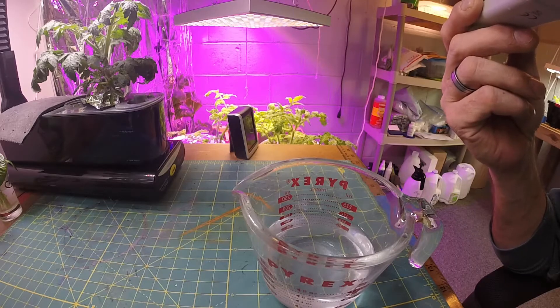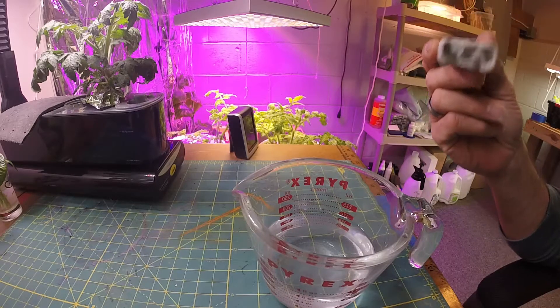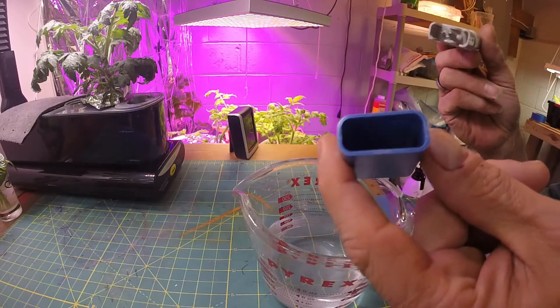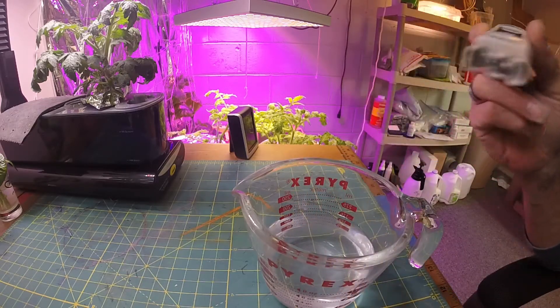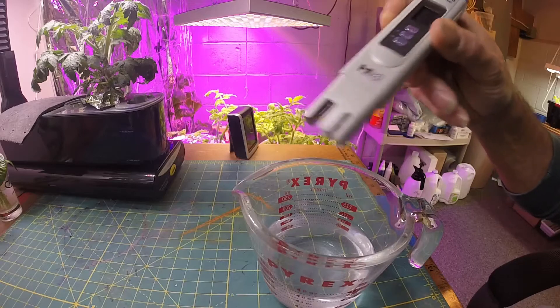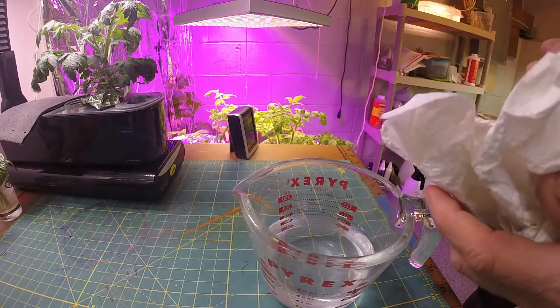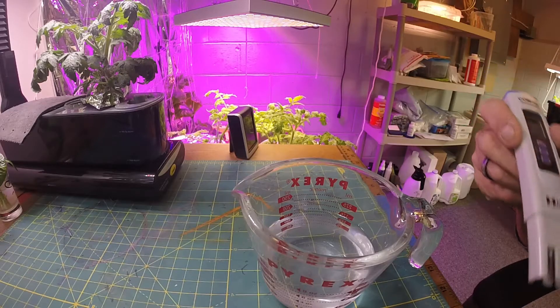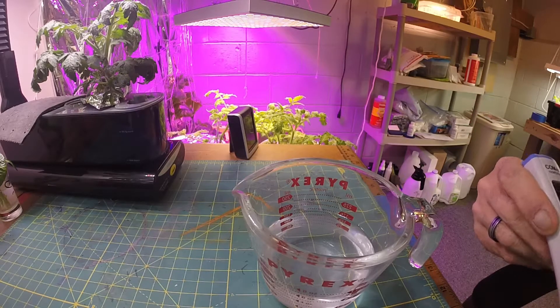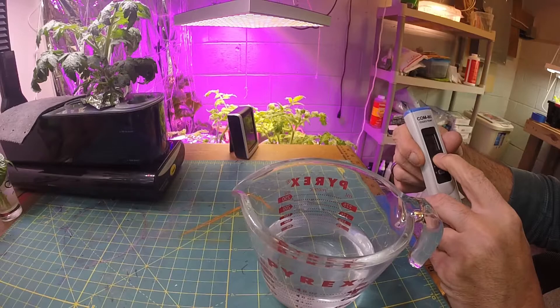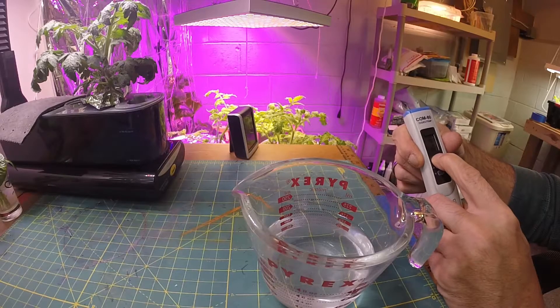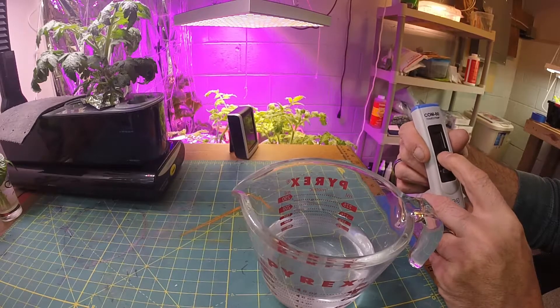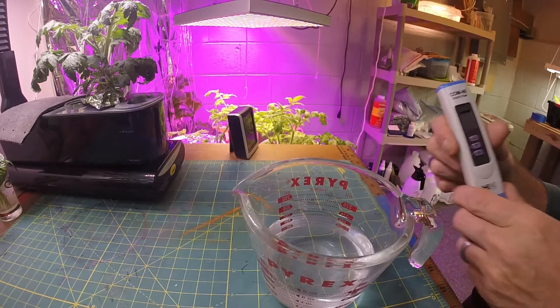Okay, so again this one too, you rinse it off. You're supposed to rinse it off with distilled water or water that's like a 7.0. Now this doesn't have anything in the bottom, it's just a regular cap. So it just says rinse it. I'll just wipe the outside edge off a little bit and then put it back in its cap. Then press and hold the power button until it goes off. Oh, you just press it once and it goes off.